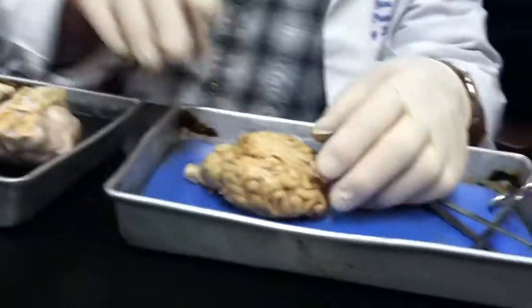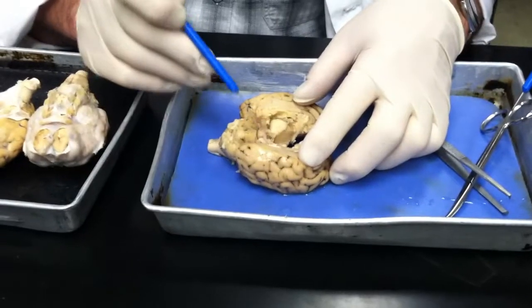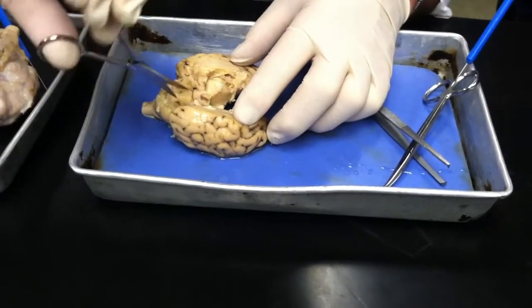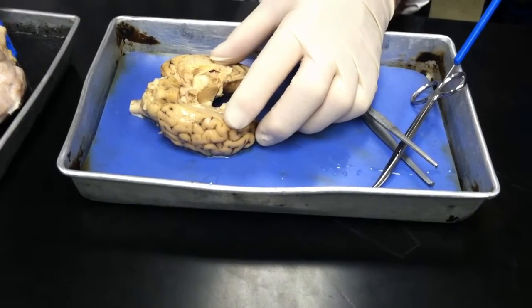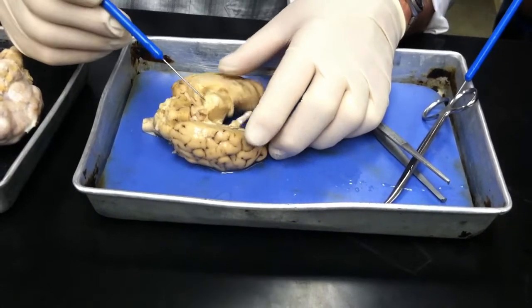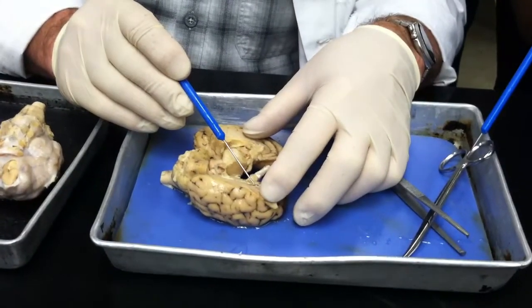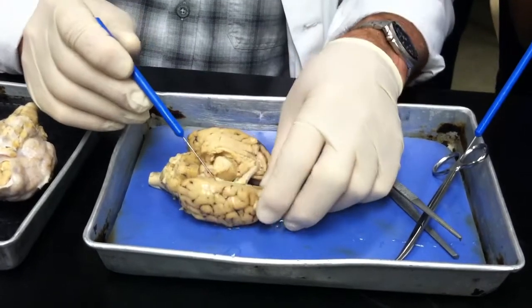Yeah, so better on this side. Okay, so, not much of a surgeon here, but let me make a little cut like there. You can see there's an obvious ridge of white-looking matter running up here, right along there. I'm sorry, you can't see it very well, can you?